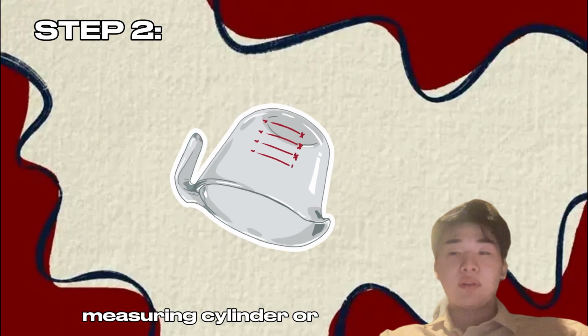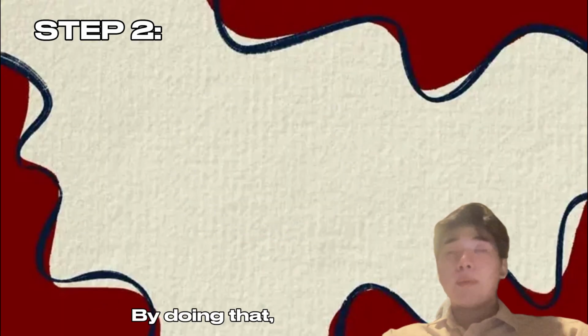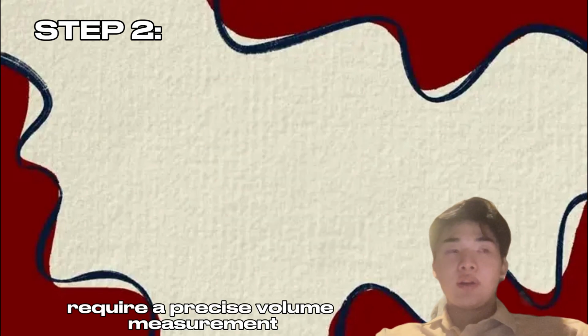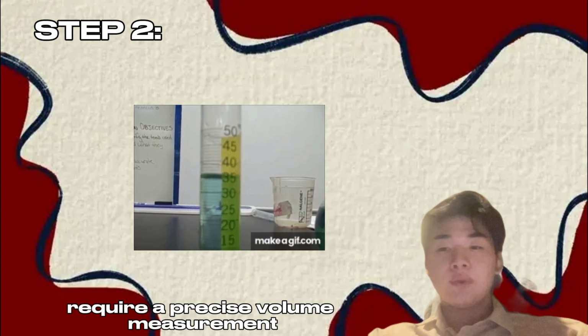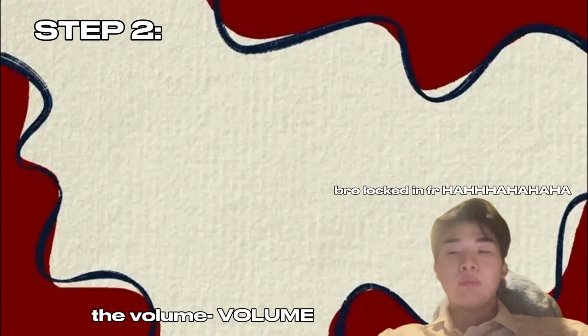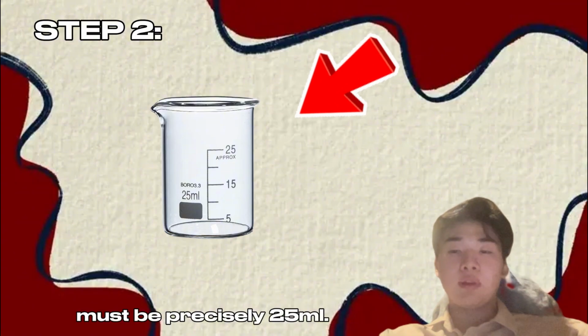And step 2, pour 25 milliliters of water into the cup after carefully measuring it using a measuring cylinder or other measuring tools. Density calculations require a precise volume measurement. Hence, the volume must be precisely 25 milliliters.